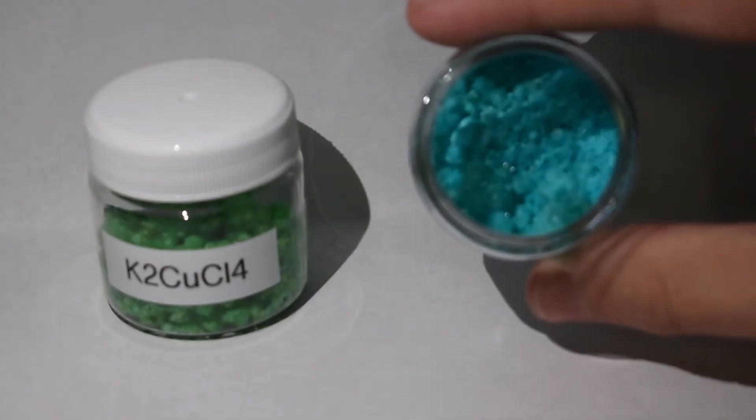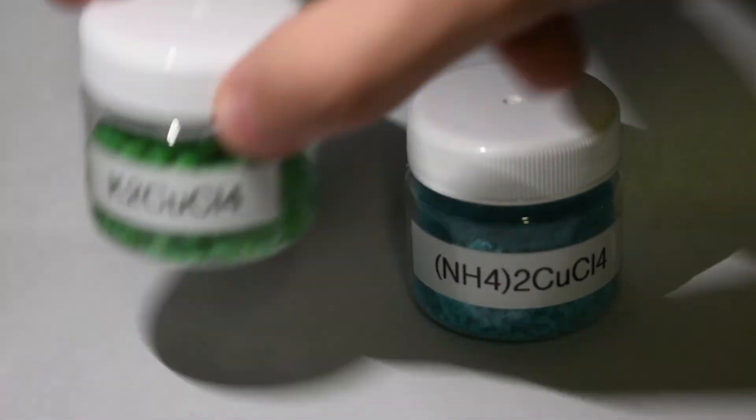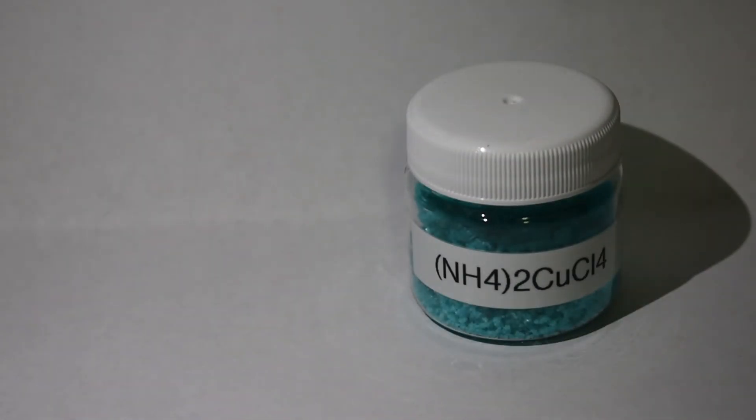See the ammonium salt in there. And the potassium salt, when it dried it turned a little bit lighter green, but still a really nice color as well.